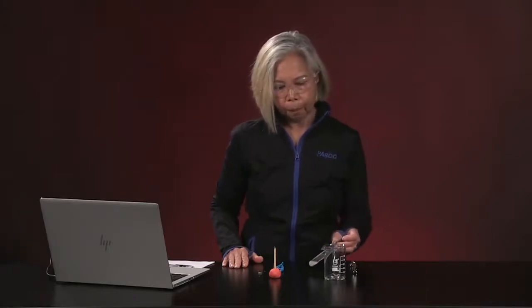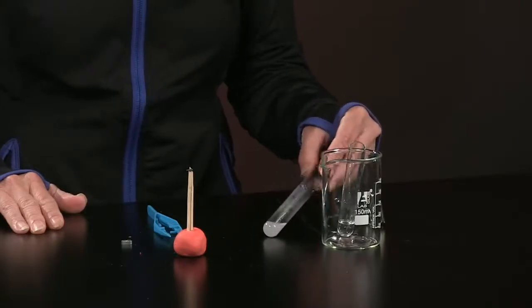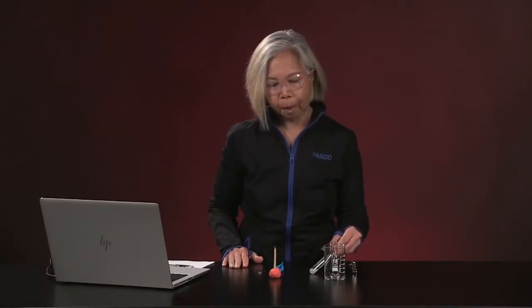You remember that experiment C where we mixed zinc and hydrochloric acid and it was going a little slowly? Well, let's take a look at it now. After a little while, you can see that it is almost white in color, and that's because it's producing thousands of little gas bubbles, right? But I will tell you, it's not quite going fast enough for me.